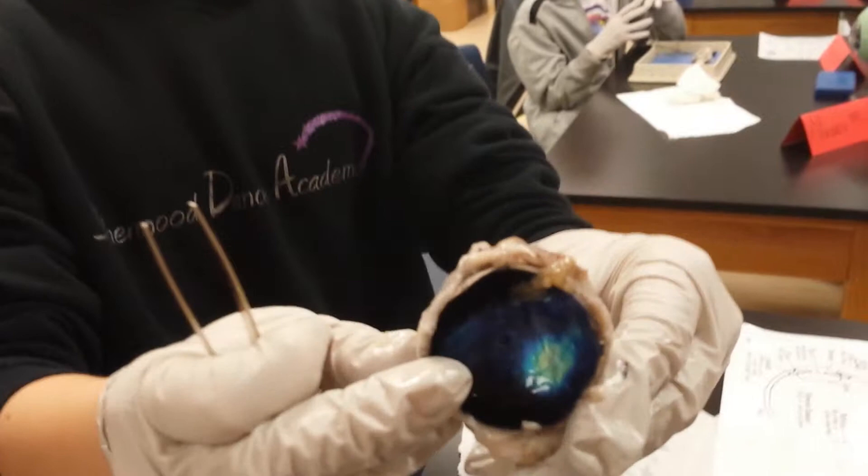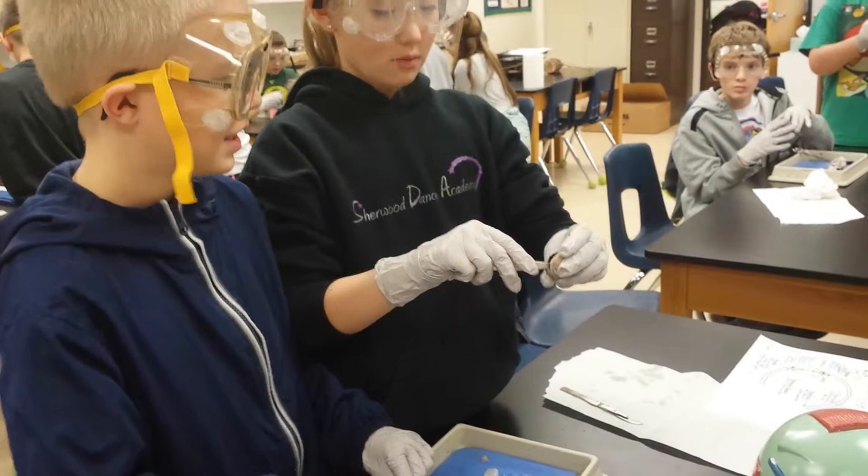Hey, what did you guys find? We found this. What is that? I don't know. We found everything. Back of the eyeball. Yeah, back of the eyeball.